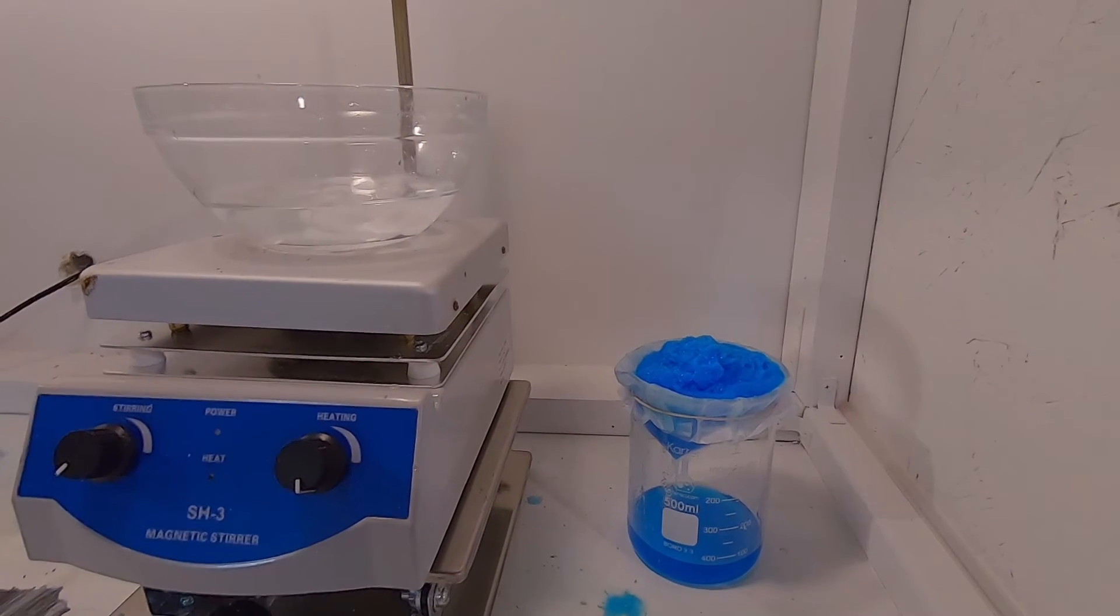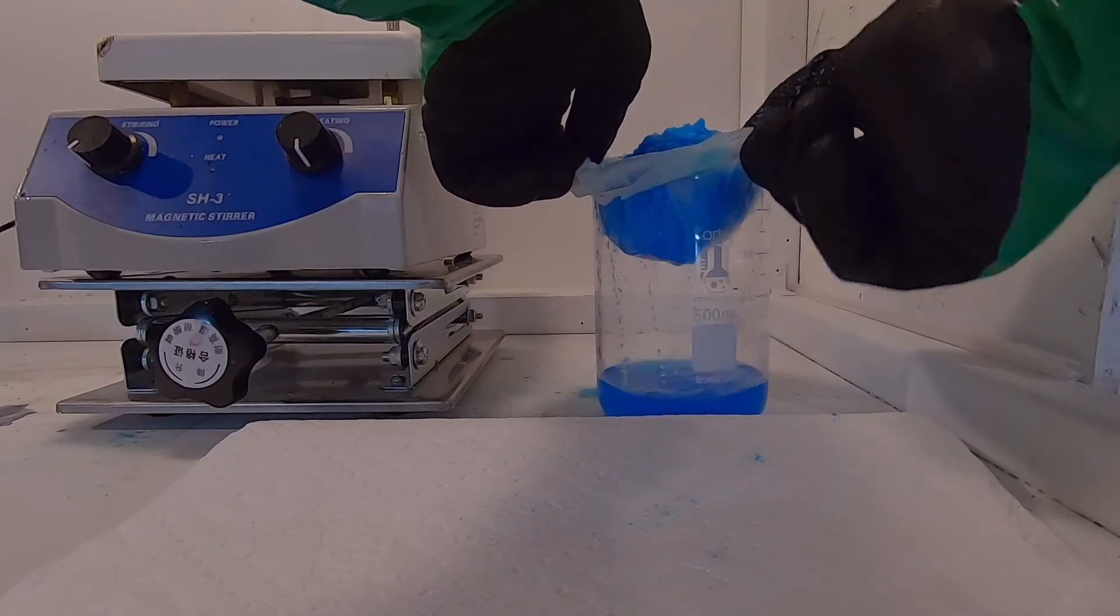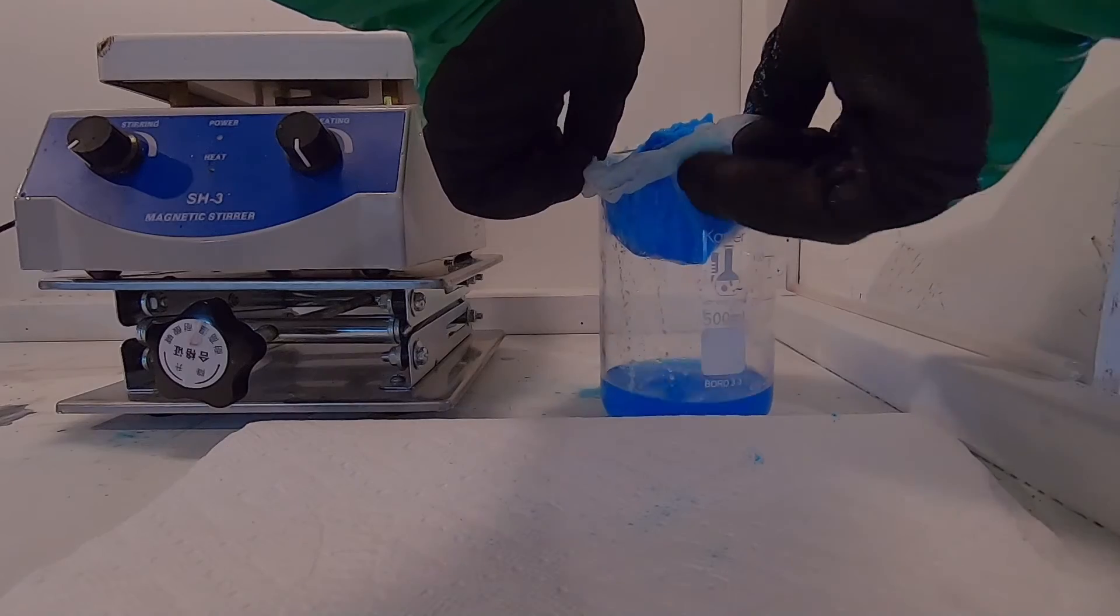I let the crystals dry over time, and I will be left with about 200 grams of pure copper sulfate crystals.